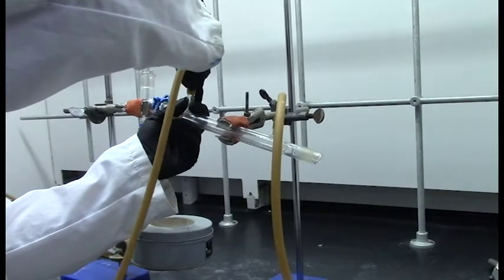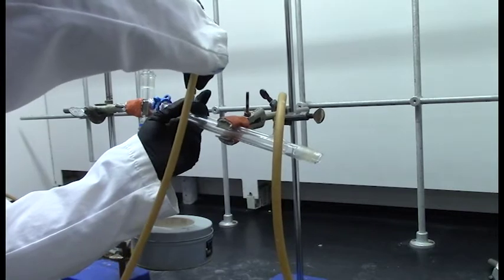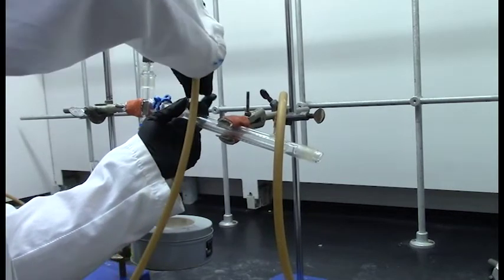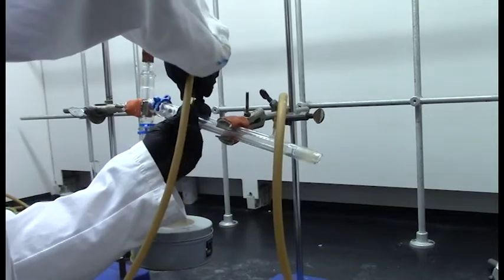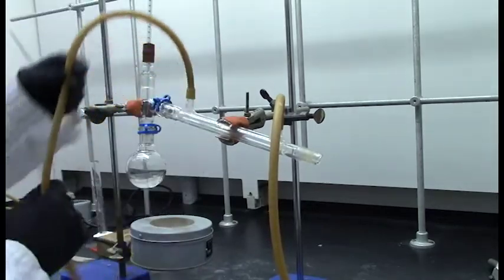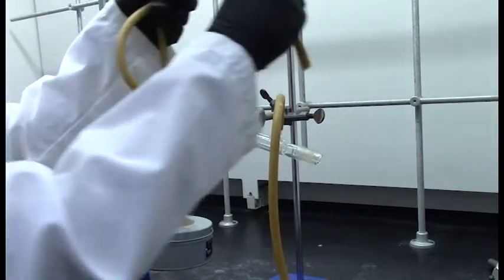Place the thermometer so its tip is just slightly below the sidearm. Attach the water hoses as shown. Make sure the out hose is long enough to fit into the drain. You may move the apparatus around as needed to ensure this. Use your 25-milliliter graduated cylinder as the receiver.